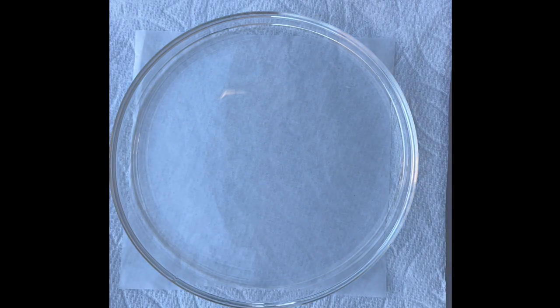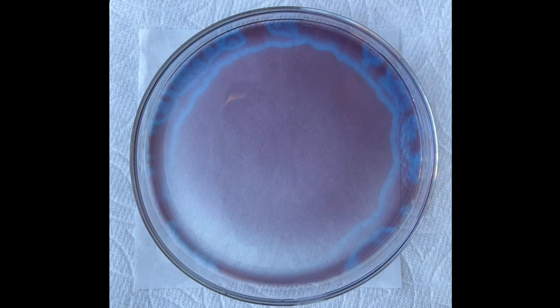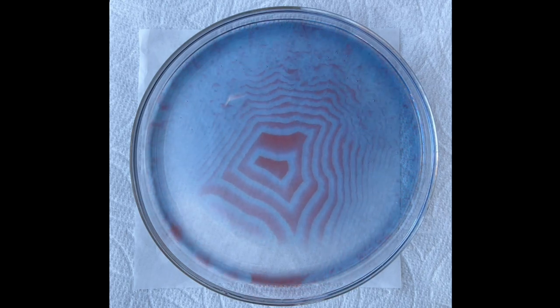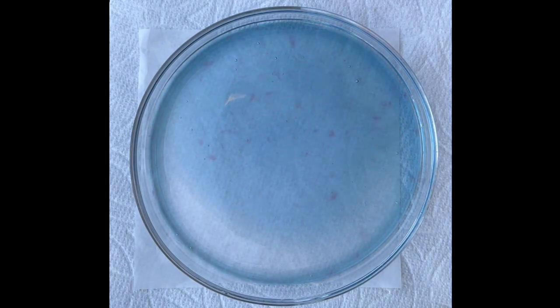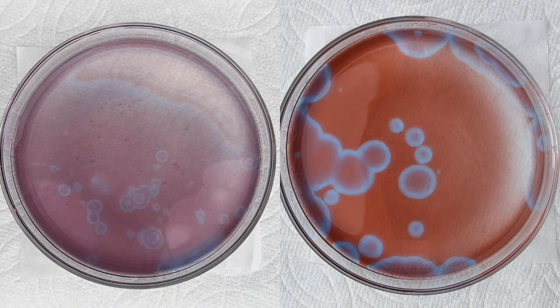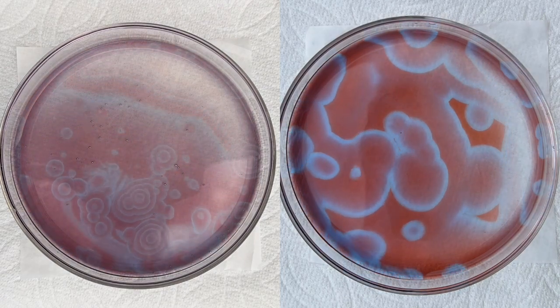And a few days later, I ran this experiment again. This time, I had to remake a new sodium bromate solution, which is solution A. After using the new solution, a different kind of wave pattern was formed. Here is a side-by-side comparison of the Ferroin-only version on the left and the cerium version on the right.